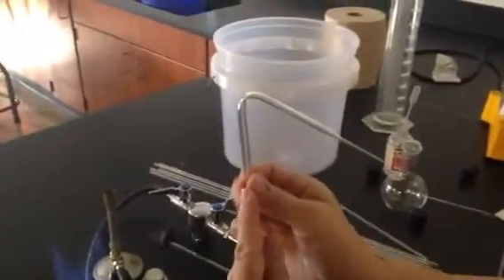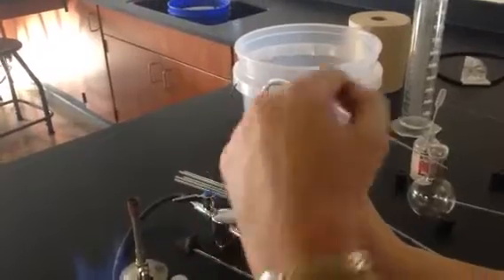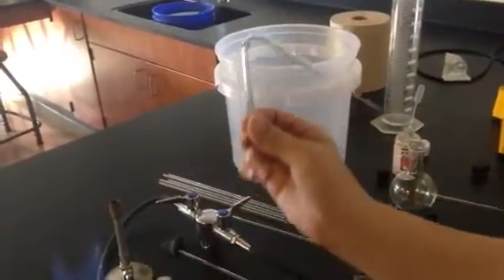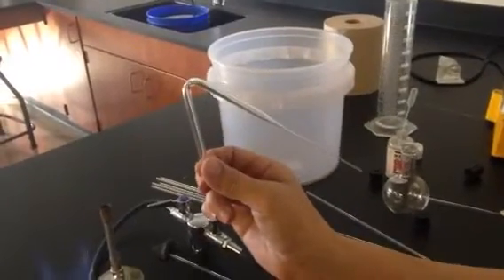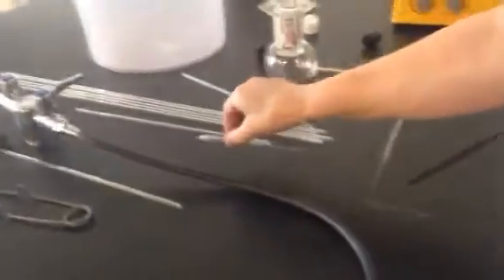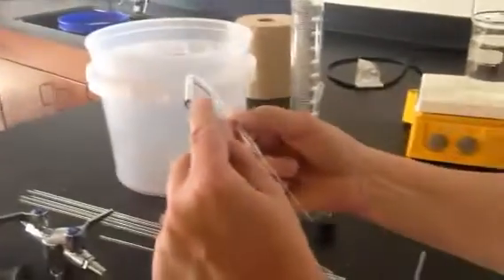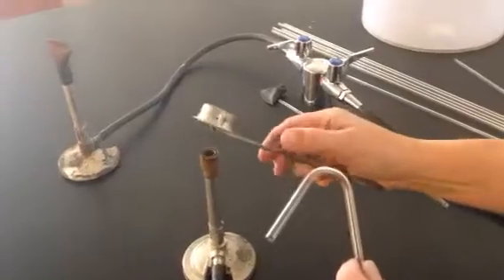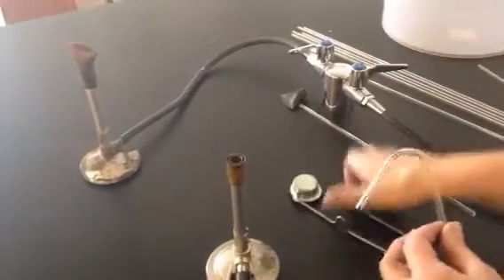You want something that is bent so it goes up and then it points down. Now the part of the flame that we bent is really, really hot. So you don't want to touch it right now. But I'm going to put that piece down and I'm going to get another piece. And one of the things it says then, once it's done, is you want to fire polish the ends. So I need a little bit of gas.